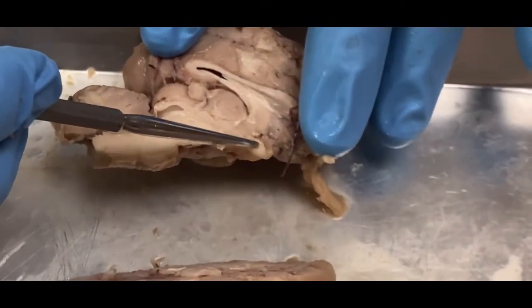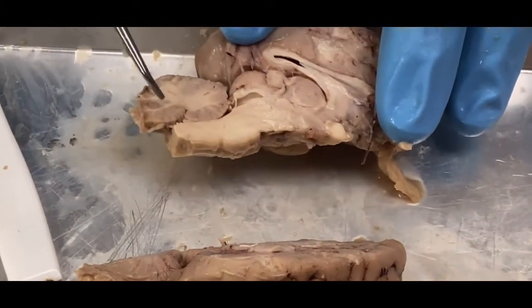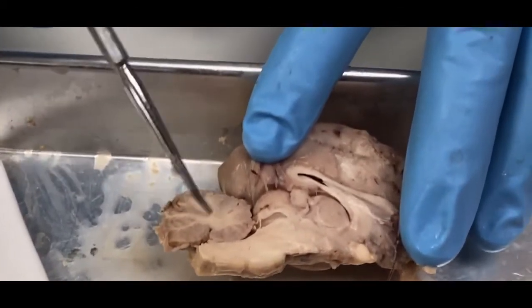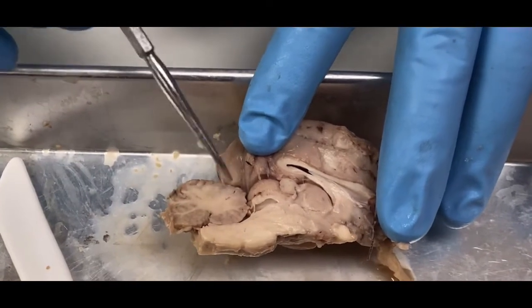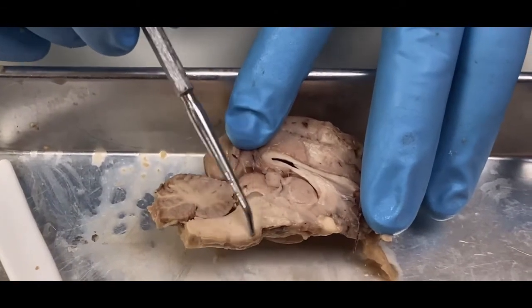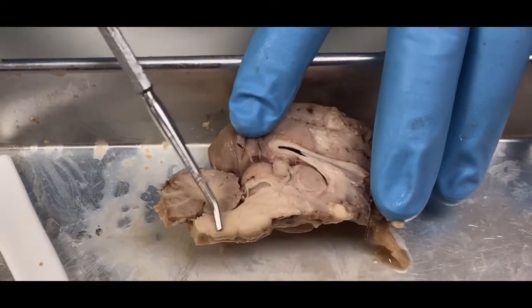This is my optic nerve that's still right there. And then if you notice, this is my cerebellum, which we've cut in half. If you notice, it's a tree-like structure there, and this is called arbor vitae. The white that you see here is myelinated fibers. So this other part is gray matter, and this is called the arbor vitae. This would be my pons right here, where you see that little part sticking out. This would be my midbrain, and then this is going to be my medulla oblongata.